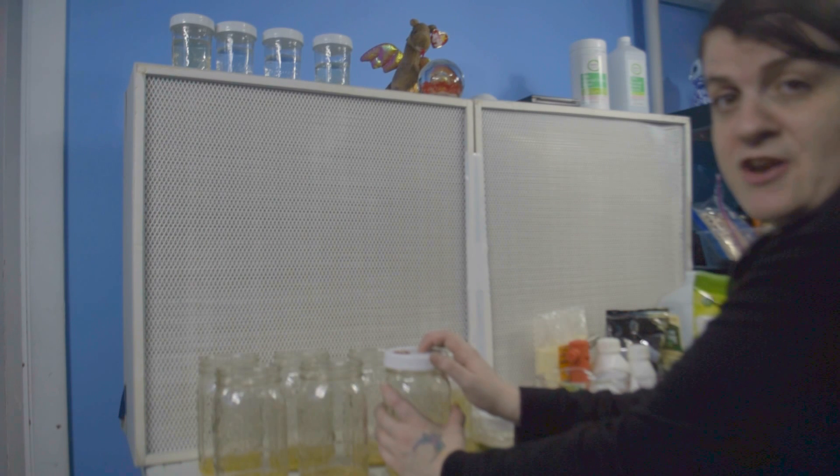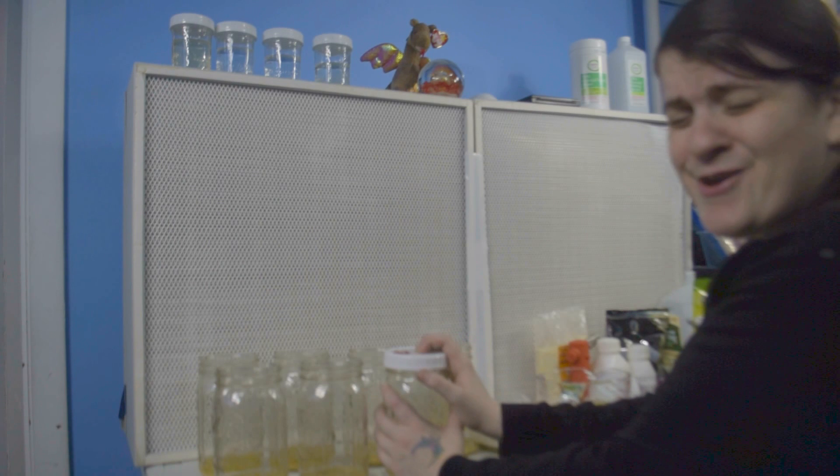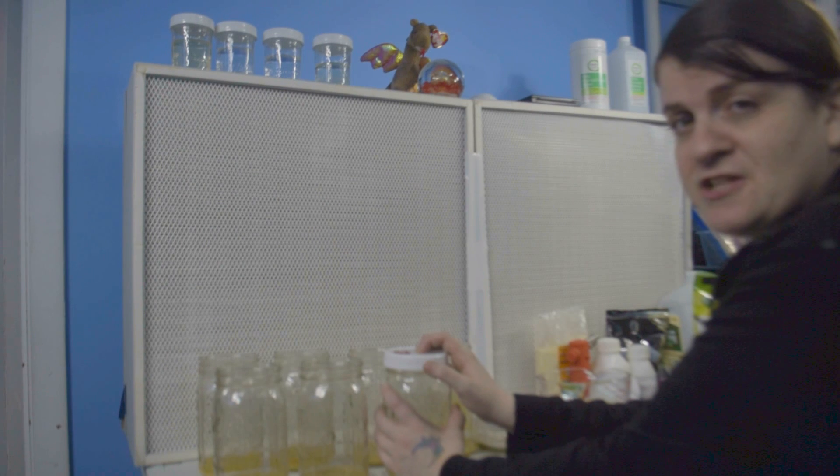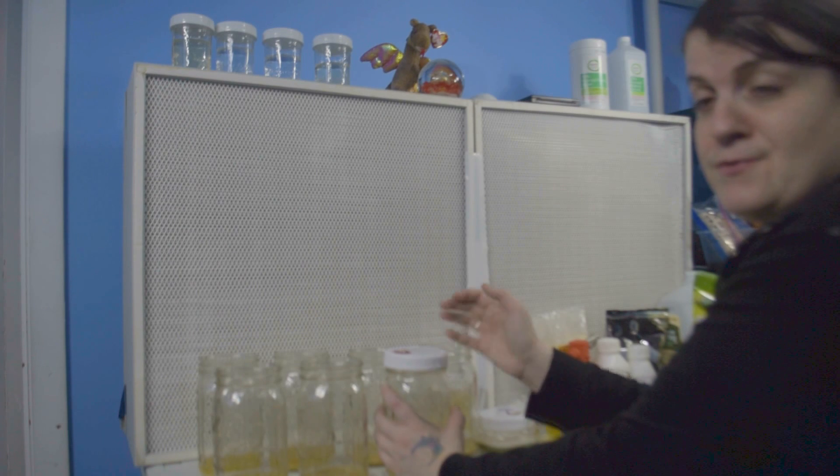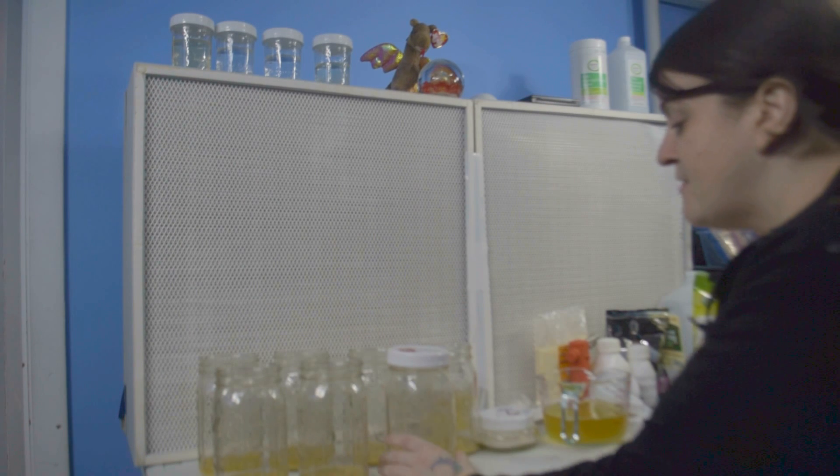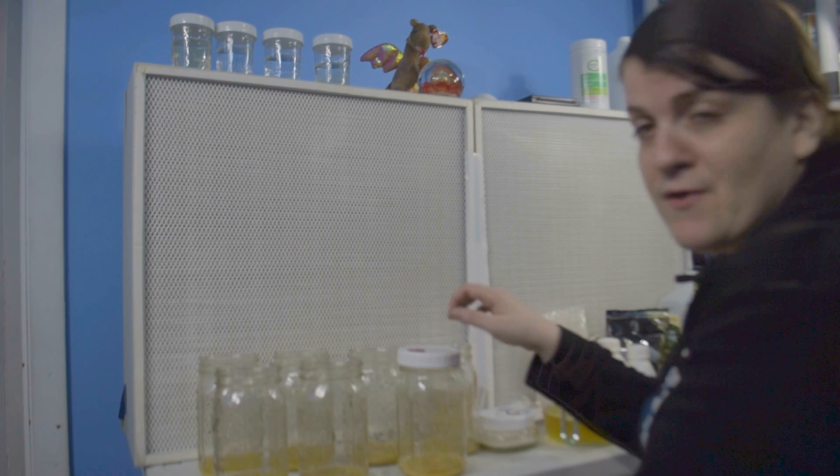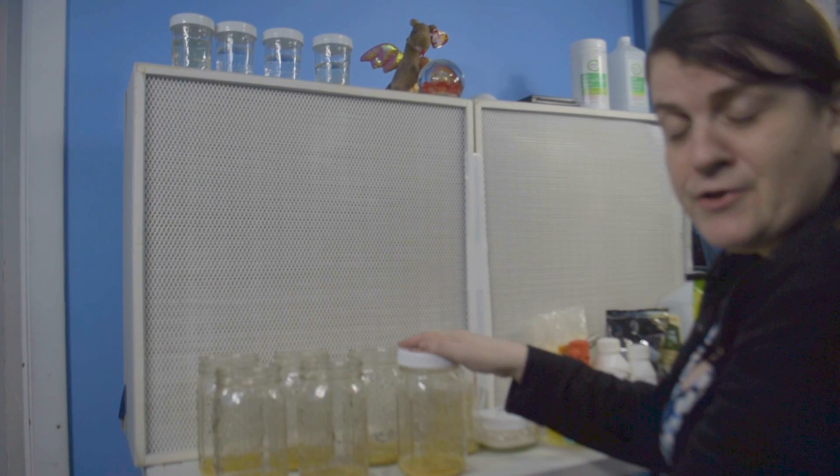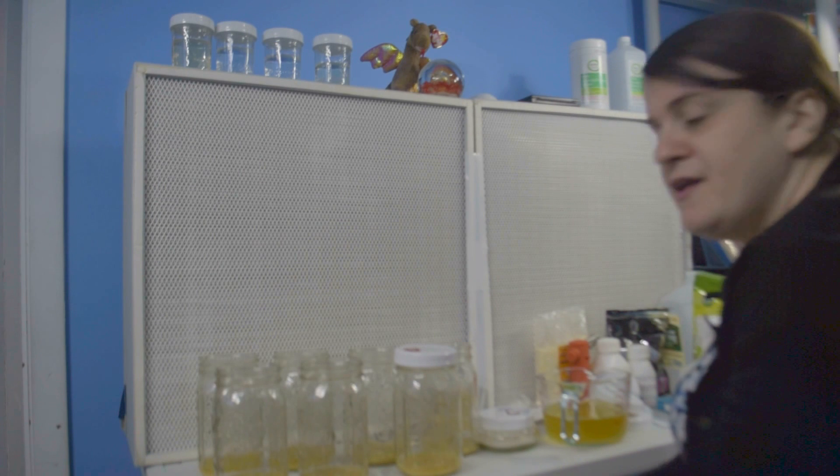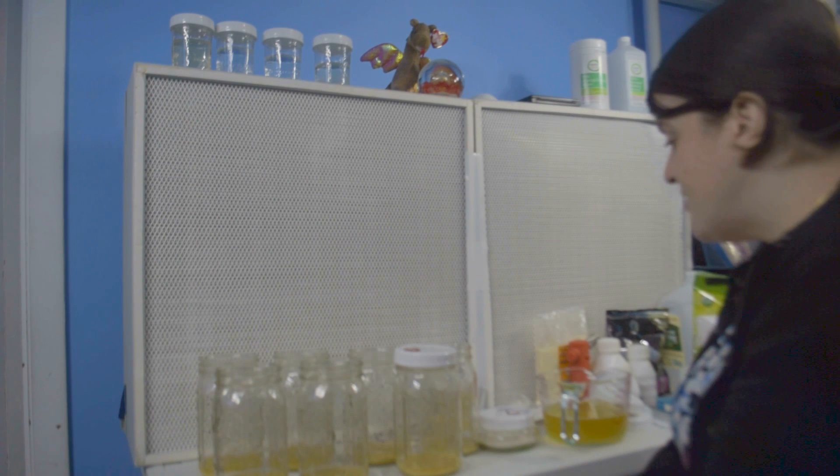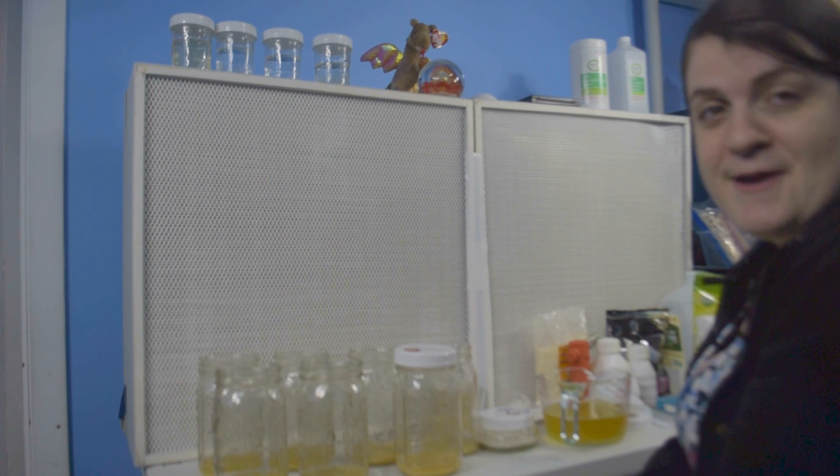And I'm going to be pressure cooking these tonight, letting them cool, and either tonight or tomorrow finishing this up. So hopefully you enjoyed my video, even though I'm still really new to this and not too sure what I'm doing. But I think something might come of this. I might get lucky.